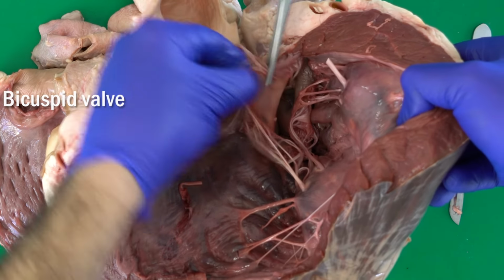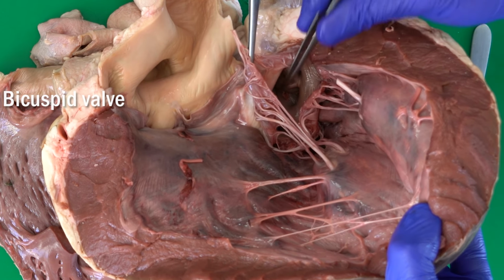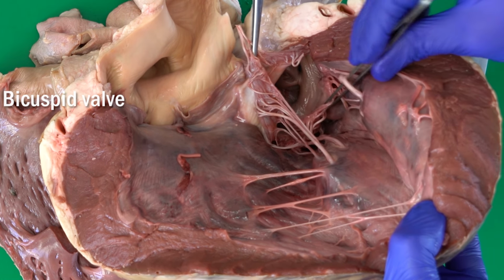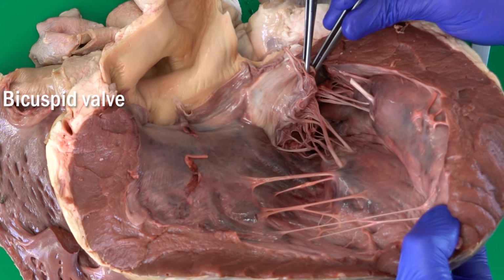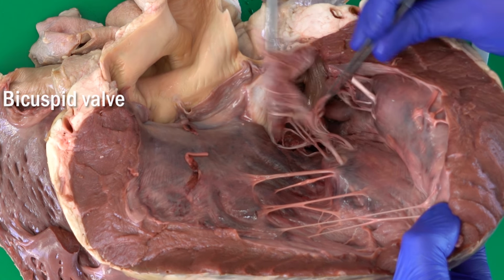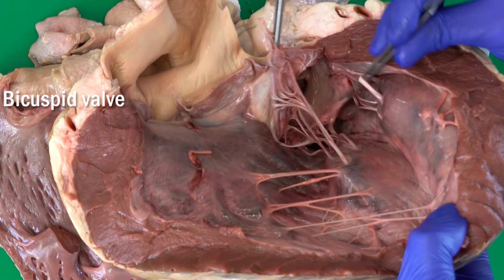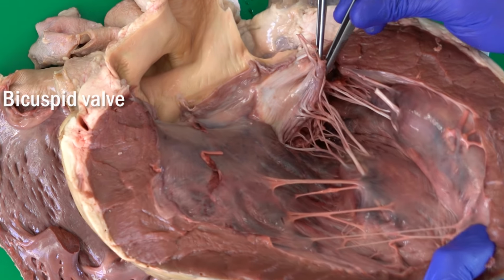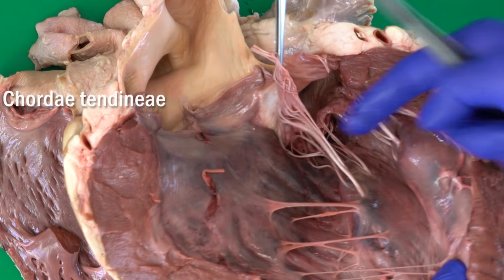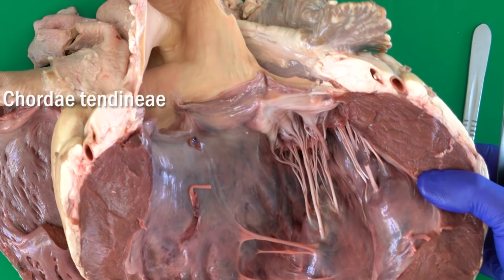In exactly the same way, this valve is responsible for allowing the blood to come from the left atrium to the left ventricle, but at the same time to avoid the blood from going back from the ventricle to the atrium. So it comes in, but it's not allowed to come back. In, not back. Okay? And what is the name of this? Strong tendons, chordae tendineae, to the papillary muscles. I hope everything is clear now.